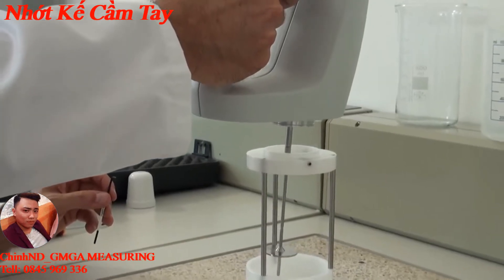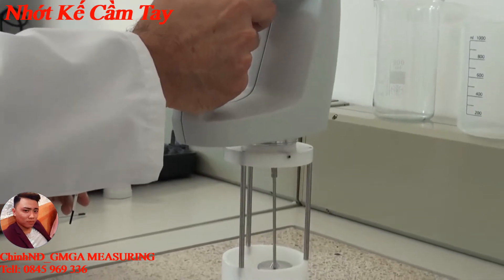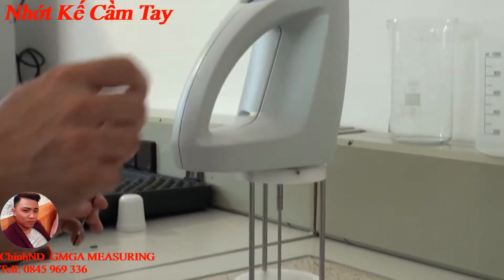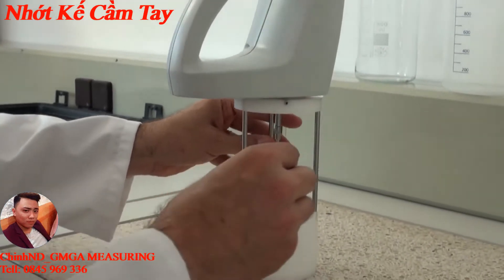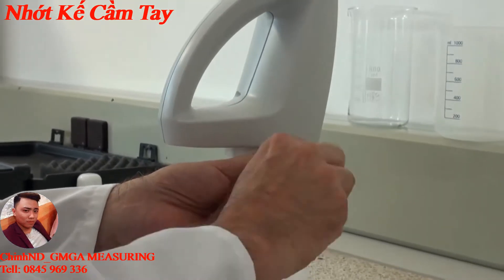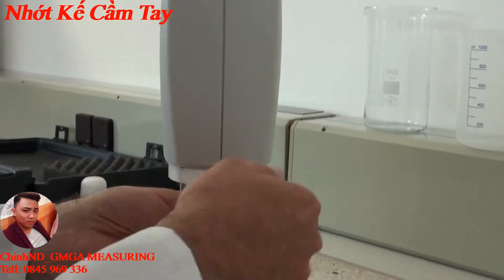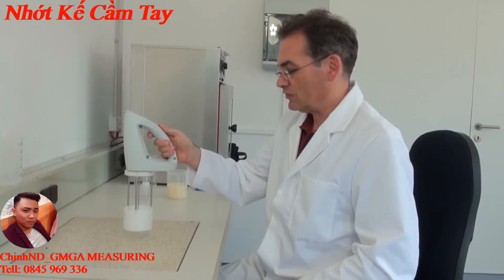To secure the viscosity meter onto the protection cage, it is mounted on it and with the help of the three-sided allen screws and the allen key it is screwed on. Now the viscosity meter is fixed with the stand and is ready to use.